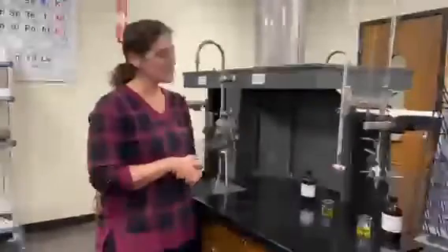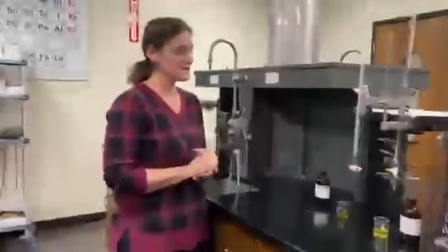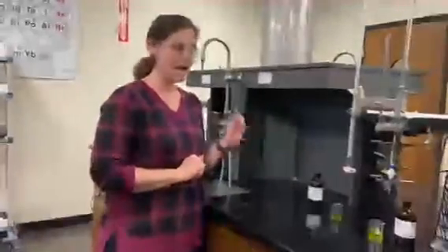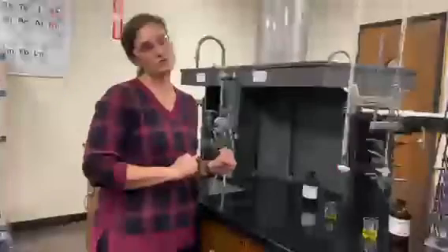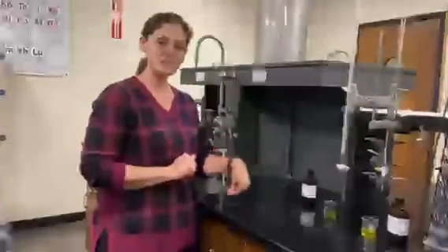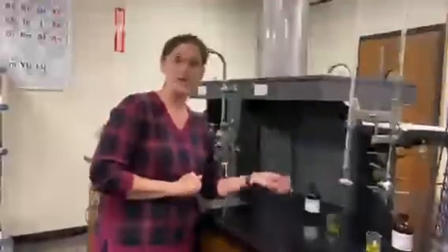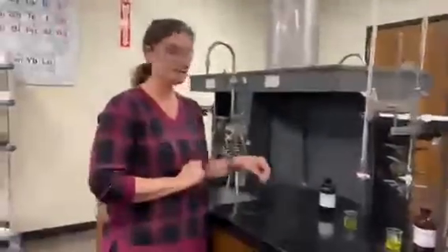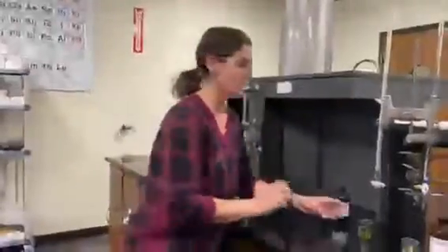indicator. The indicator that's going to be used is potassium chromate. It's going to turn to this brown color after all the chloride ions react. So the chloride ions initially are going to precipitate out the silver so we can determine how much silver, because we know how much chloride ions that we have in solution. And then once we've reacted it all, we'll see this brown color remain.